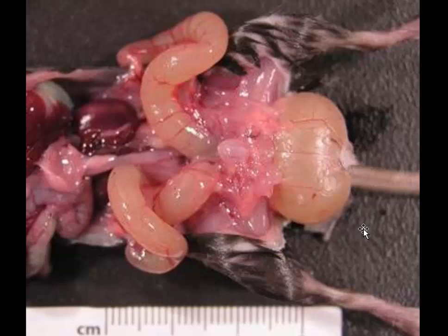There is no discharge of fluid from the uterus. The uterus fills, it fills and distends the vagina, and this is the typical appearance. If you've never seen it, you'll remember it next time. Imperforate hymen and mucometra in a C57 black mouse.